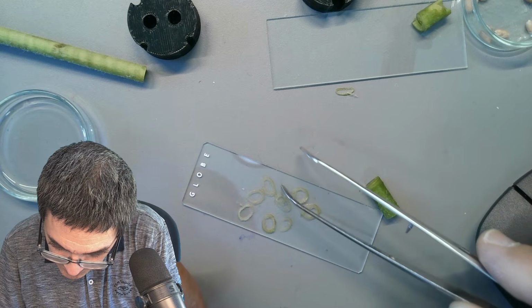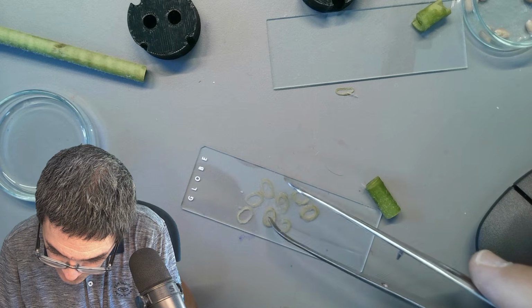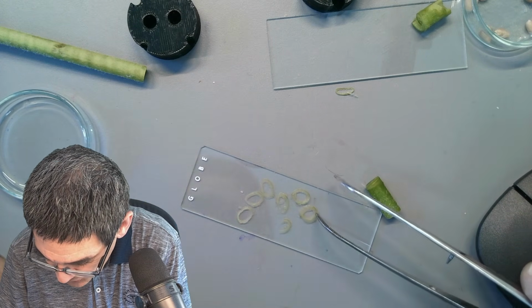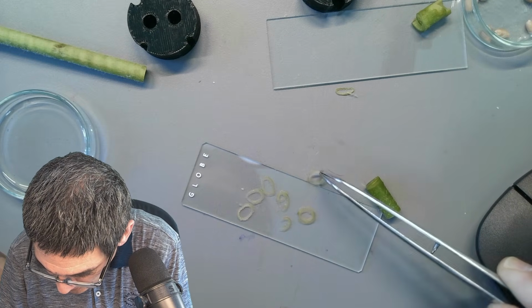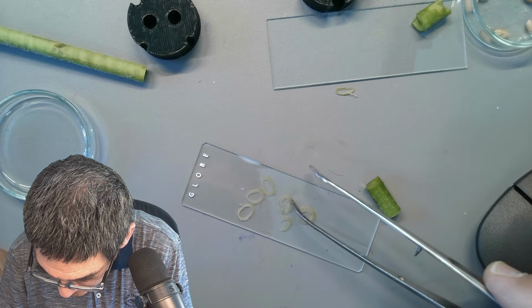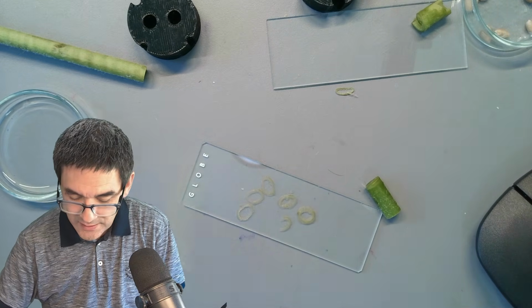Maybe less of a problem for plant cells because they have a strong cell wall. I'm not saying it's not a problem, just possibly less of a problem, but you never know. This one is also pretty thick. Let's remove that. Here it's overlapping. Let's leave it as it is.